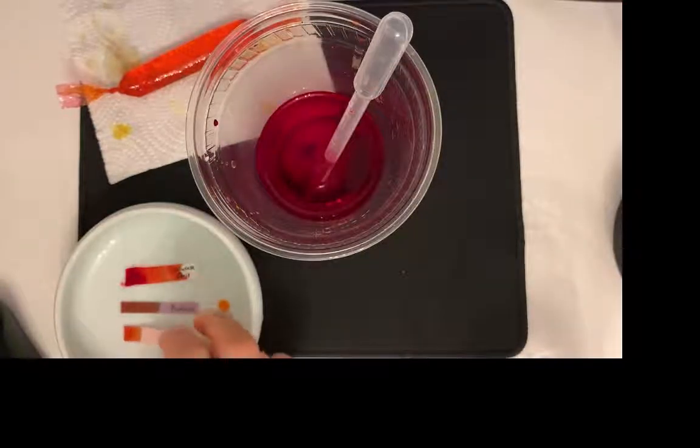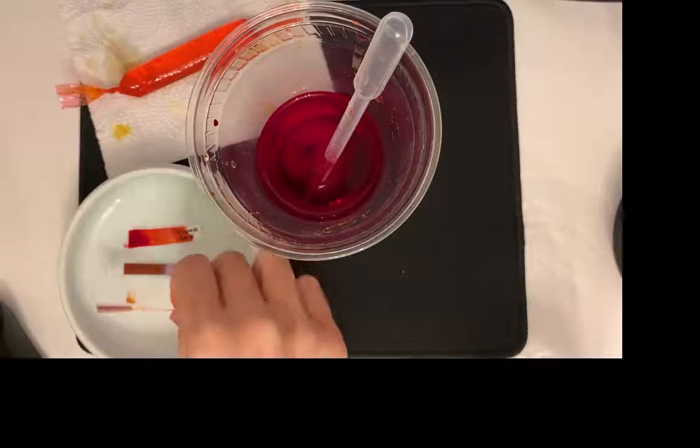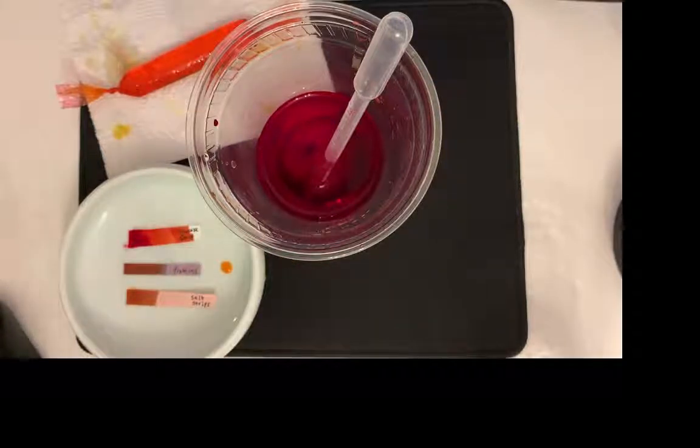It's kind of hard to see on the camera because I think the camera is picking up some weird tones. And the salt is supposed to turn light to dark purple. Okay, so I know on the camera it's looking like it's more orangey yellow, but actually it is getting darker. So let's go ahead and do this part together.